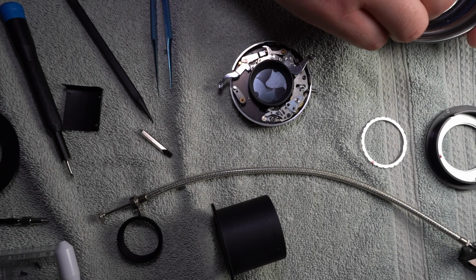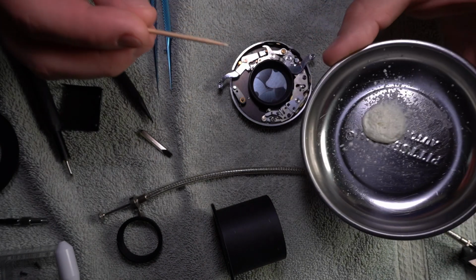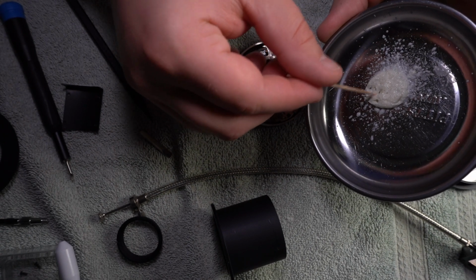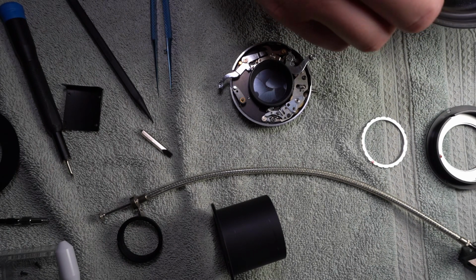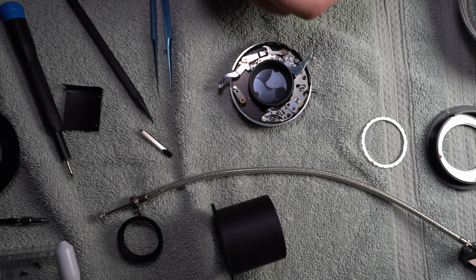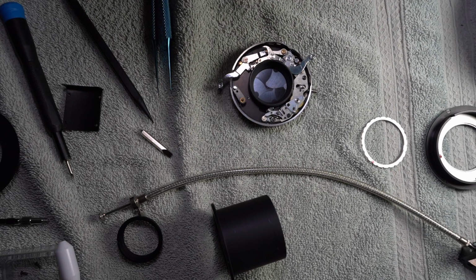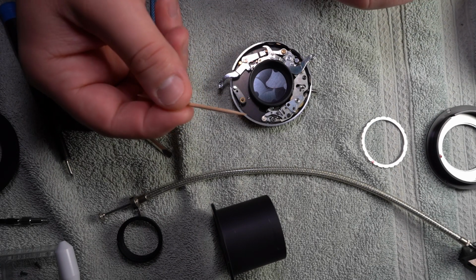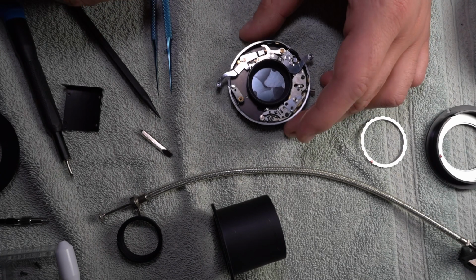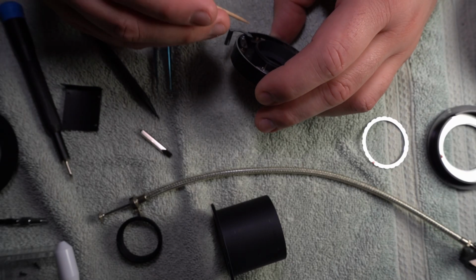This is white lithium grease, but the main selling point is that it doesn't really run. I don't know how well you can see that, but it's not sliding down or anything. If you spray this on something, it'll run, but mostly just because it's an aerosol and it shoots. You can't even tell that this is wet in the video, but it is. It's got a little bit on there, and I'm just going to try and get it in there to do this.